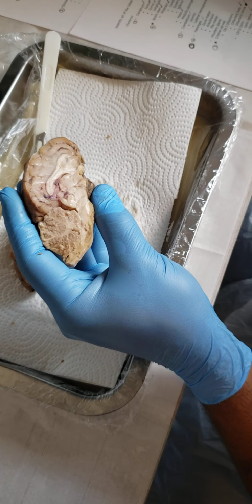Hi, I'm Guadalupe Martinez. This is for Anatomy and Physiology. I'll be showing you the parts of a dissected sheep brain. So right here I've got my sheep brain. I've got my worksheet from Bio 250 going over the parts so I can go down them. Hopefully I don't miss anything.